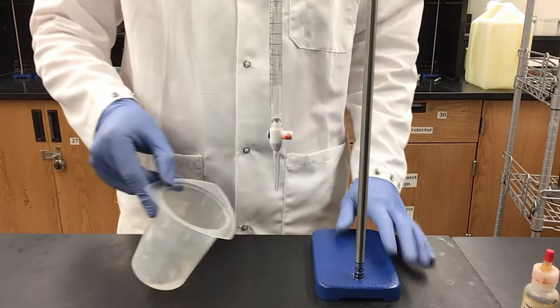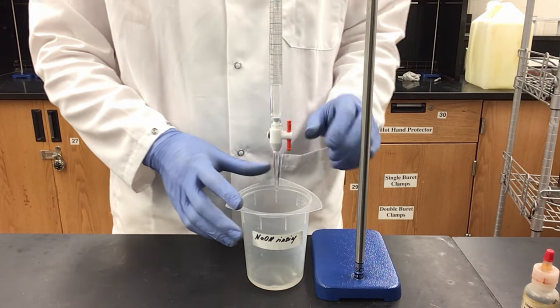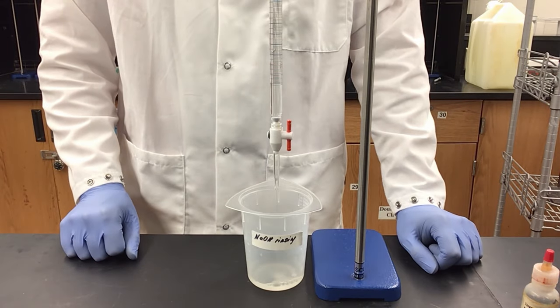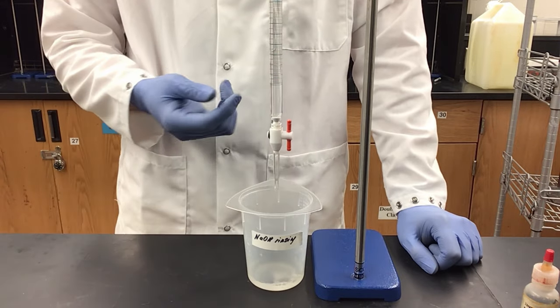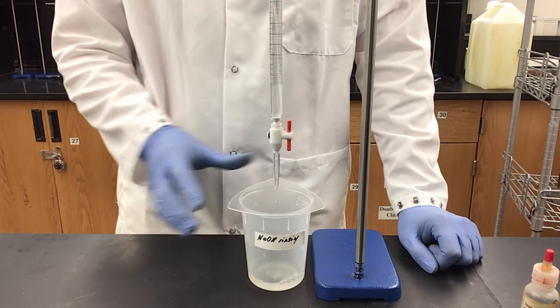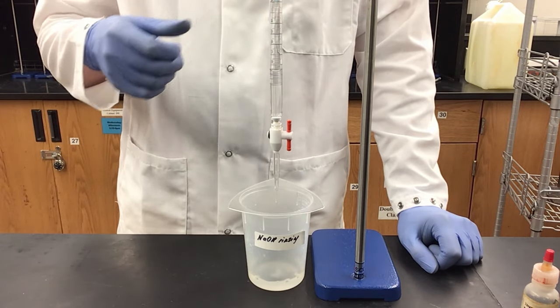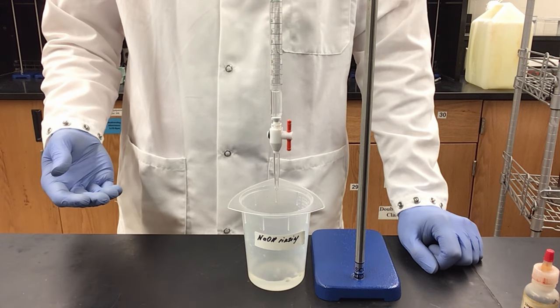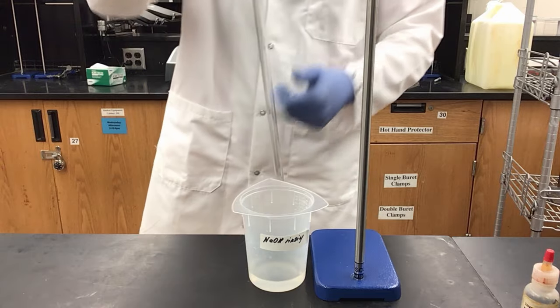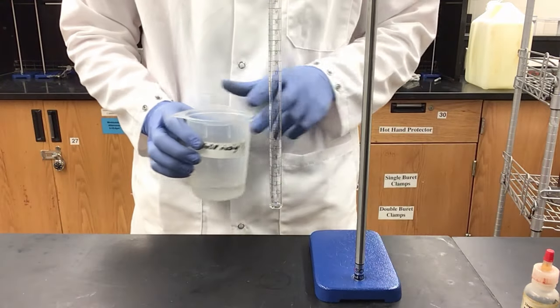Now that we are at the end of the lab, I need to take care of the sodium hydroxide still in my burette. I have my rinse beaker here — I'll empty the remainder of the sodium hydroxide into it, and this will be disposed of in the acid-base waste in lab. Once done, I'll take the emptied burette, flip it upside down, and clamp it to my double burette clamp so it is ready for the next lab. If you are the final lab at the end of the week, rinse the burette with water, fill it, and cap it so it can be put away into storage just as you found it.